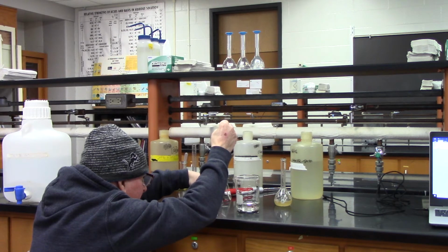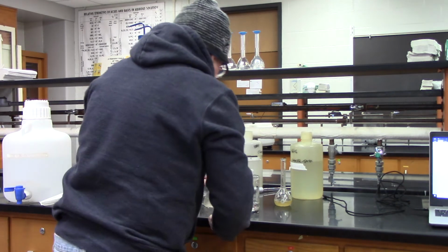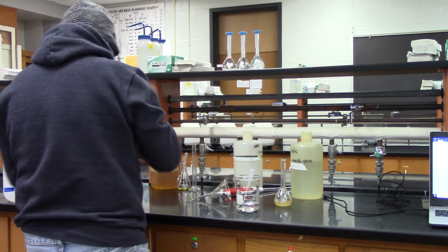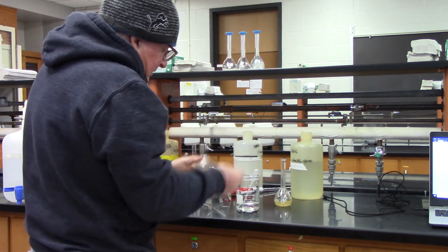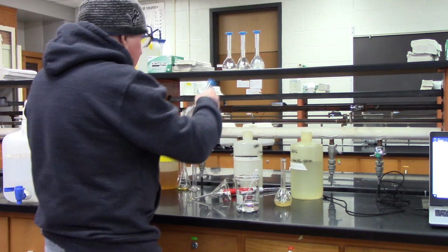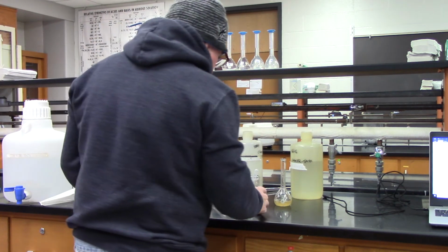Again, get the meniscus just under the line. Okay, one more.